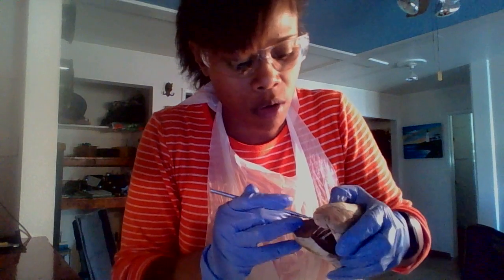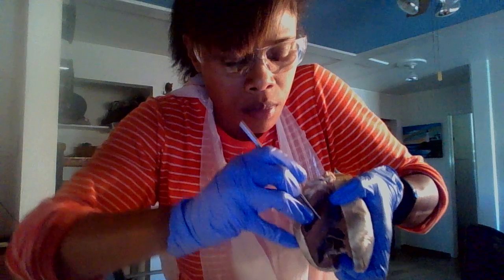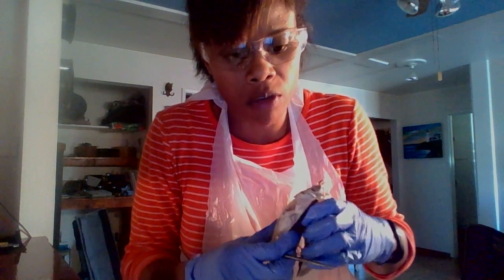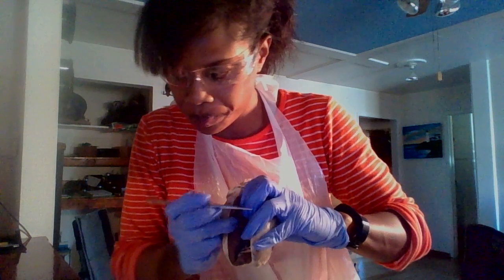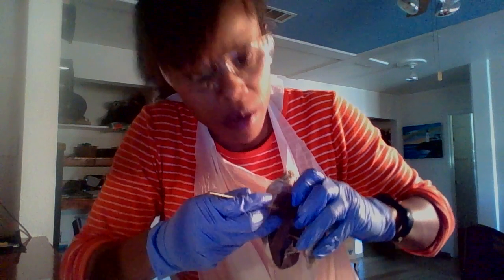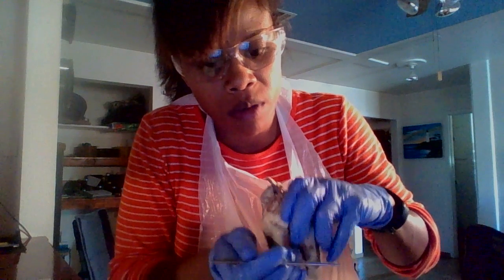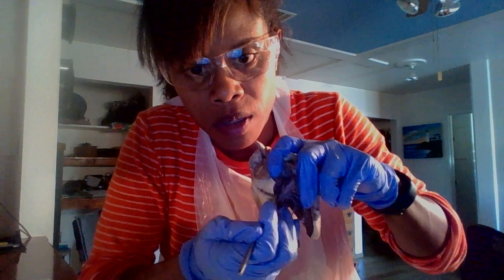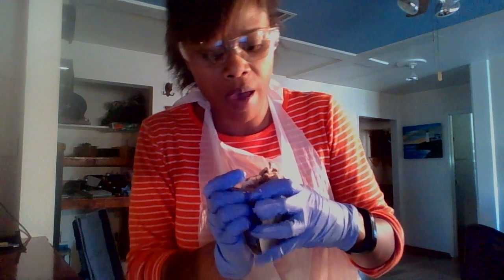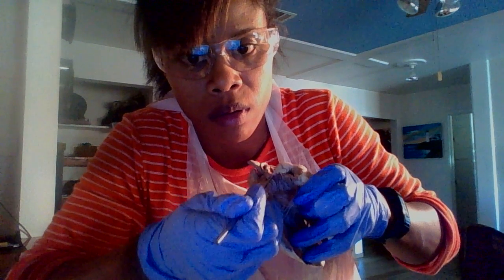The interventricular septum is cut — it's right here. The bicuspid, or the mitral left valve, is here. And the tricuspid valve is here. The cusps of the valve are right here.